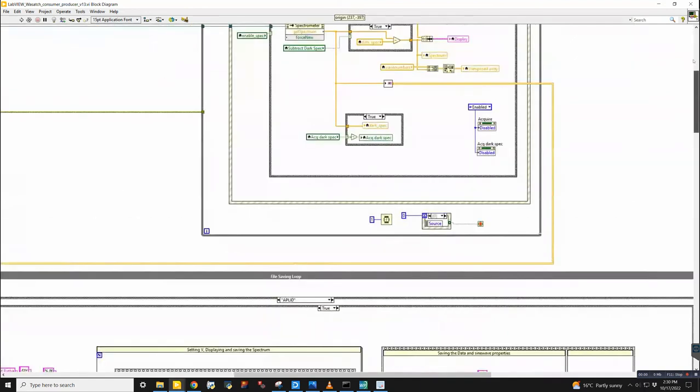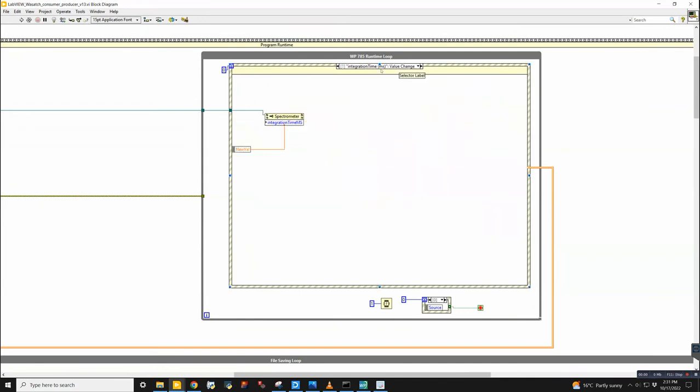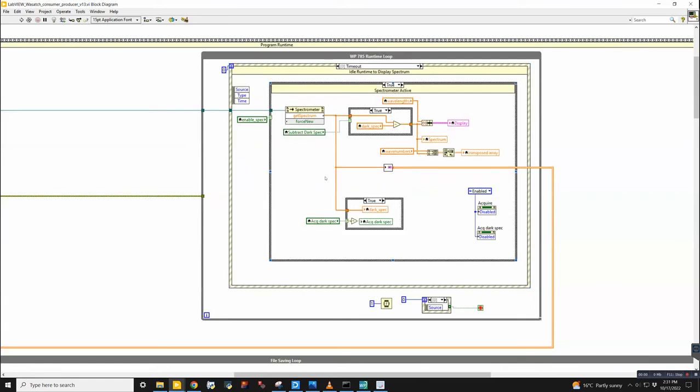The first thing that happens, and I think the most important thing, is that this Wasatch Pro 785 runtime loop has the purpose of retrieving data from the spectrometer, and that's all it does. So it will retrieve data, it will display it, it will give you the option of removing a dark spectrum that's acquired, and that's pretty much it. So it just loops indefinitely, grabbing spectra, and sometimes if you change a setting, like the integration time, it will make that change in the settings. But that's pretty much it.